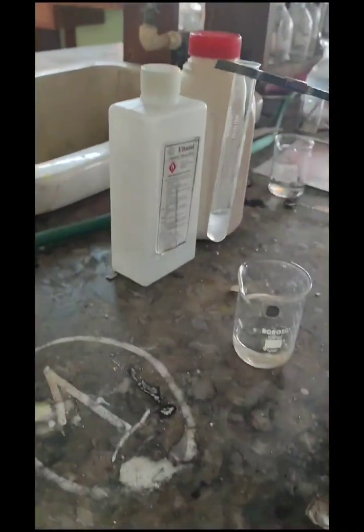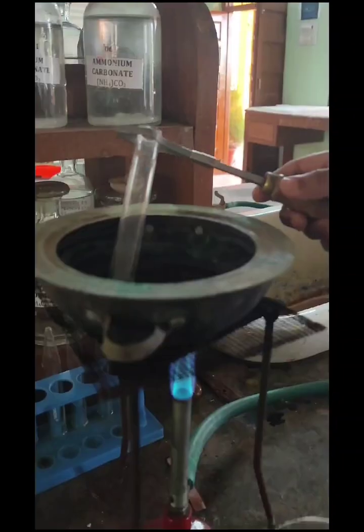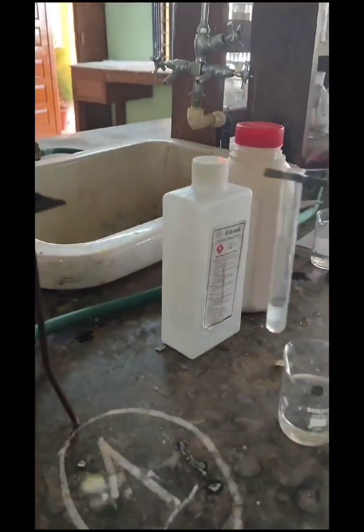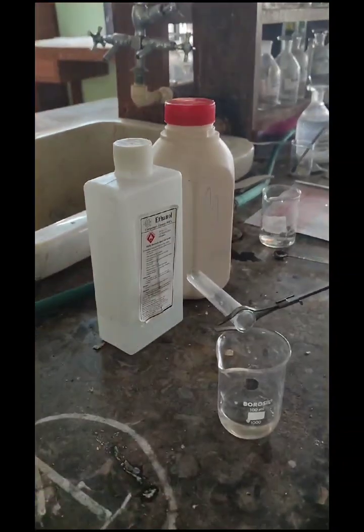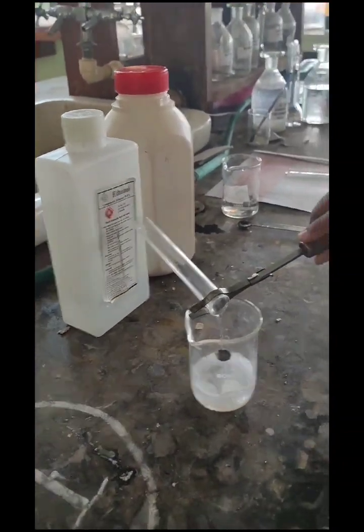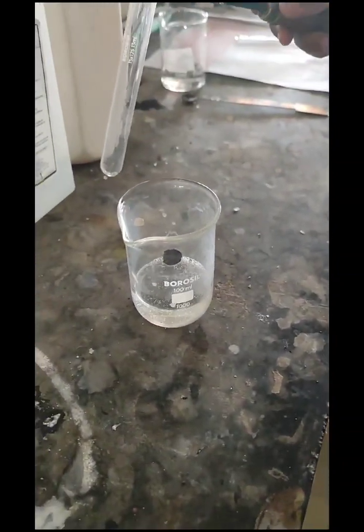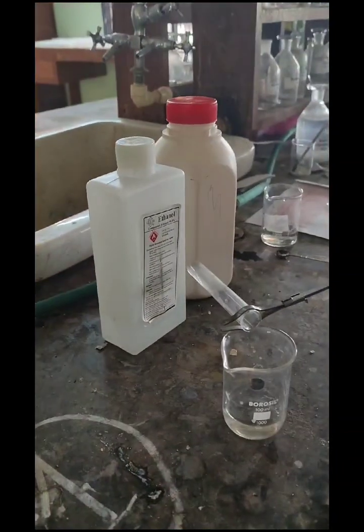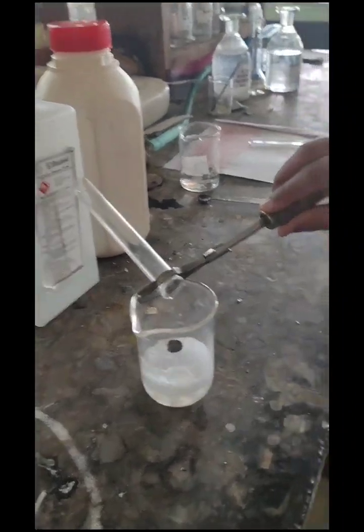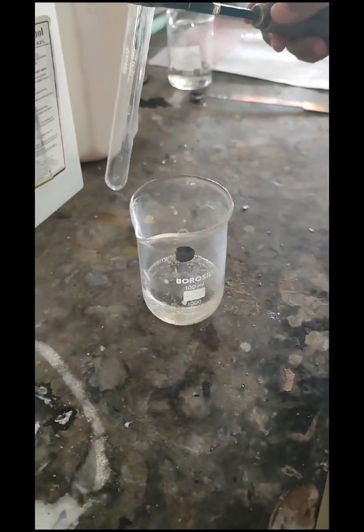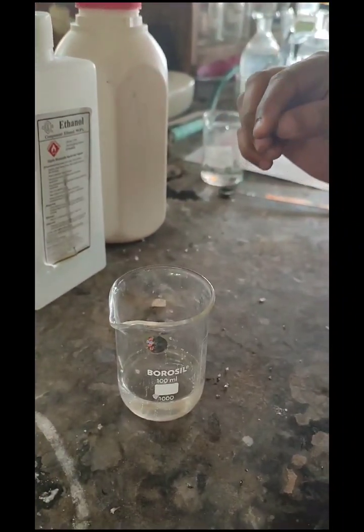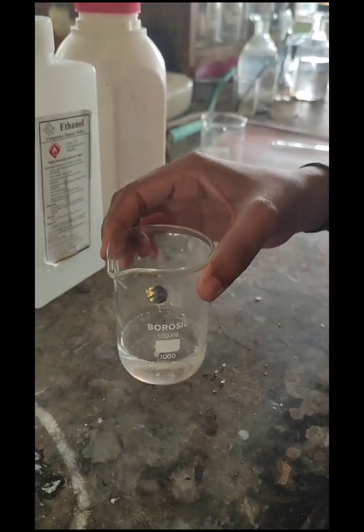After heating, pour this content into a sodium carbonate solution. If the ester odor is detected, it indicates the presence of acetate.